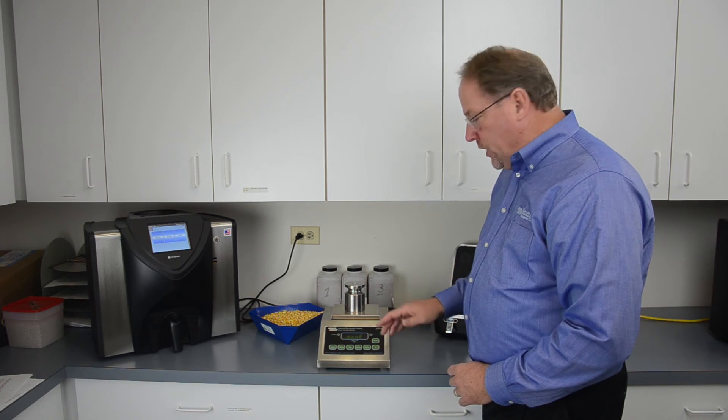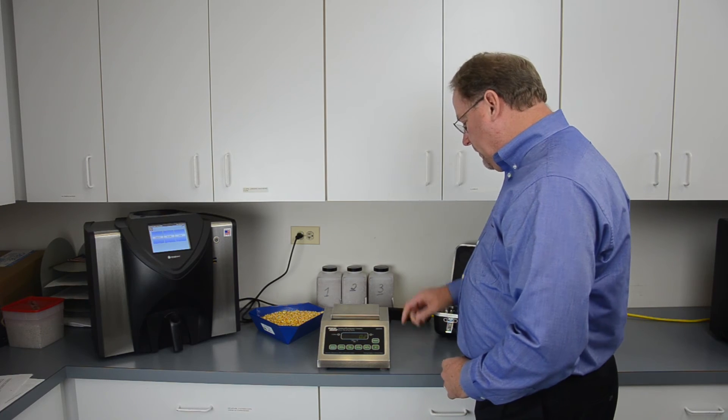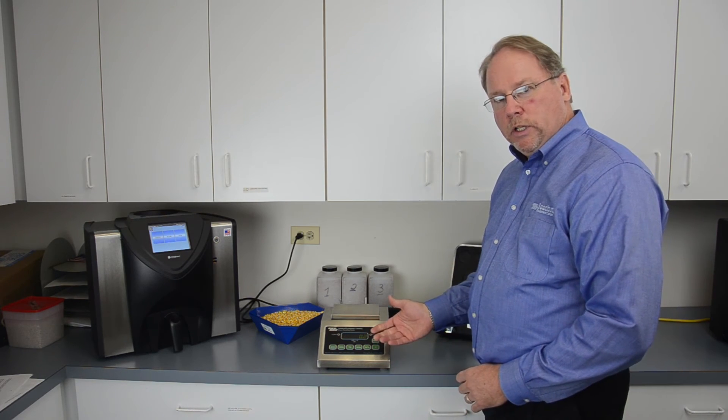It shows that it's now done. You can remove the weight, and it goes back automatically to the weight mode.